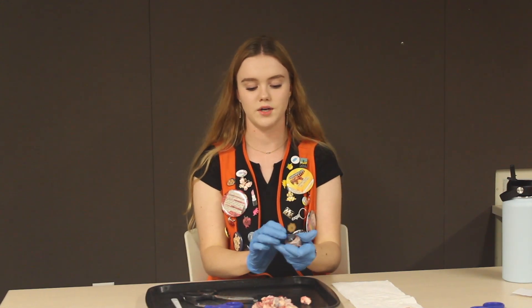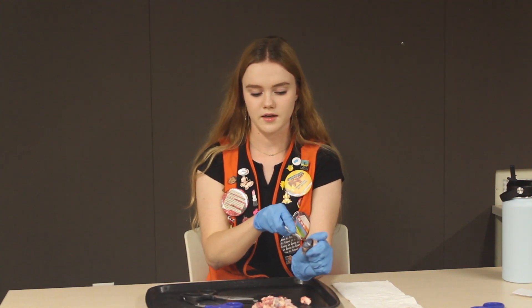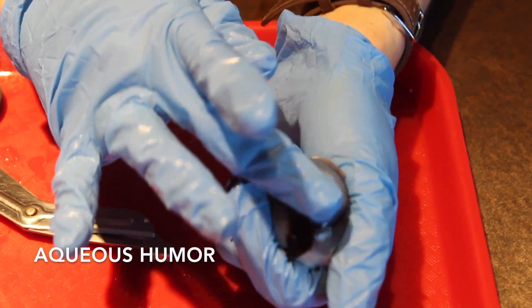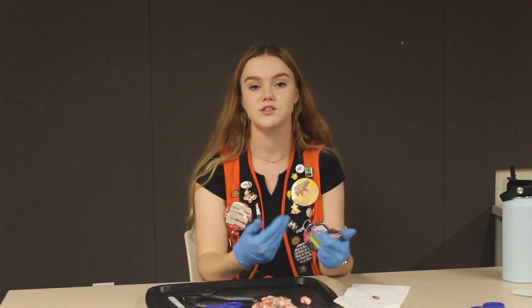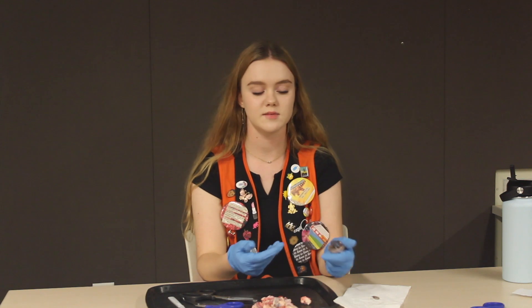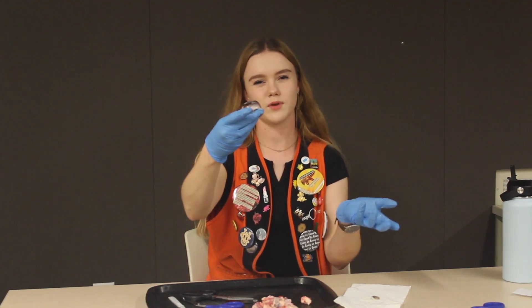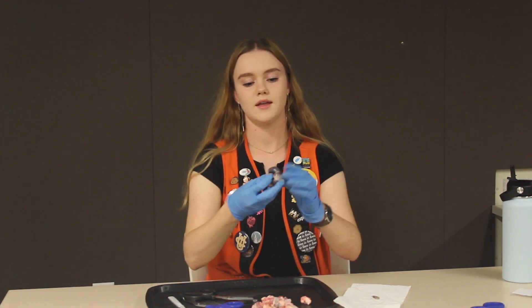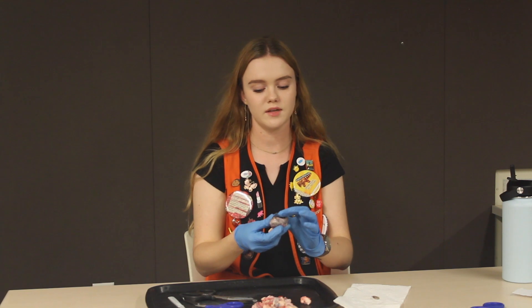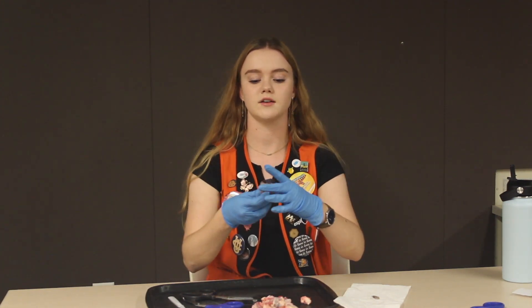What I'm going to do now is cut into the cornea. Grab the eye, just apply pressure, cut right through the cornea. This is called the aqueous humor, and what this does is provide nutrients to the eye, make sure everything is working smoothly, and it also helps with the pressure in the eye. Ever since I've cut into the cornea it's not as inflated as it used to be because all the pressure's gone. Typically the aqueous humor is clear but it's turning brown-black because the iris ring is starting to disintegrate and the color is seeping through.